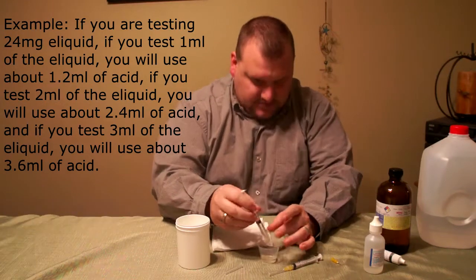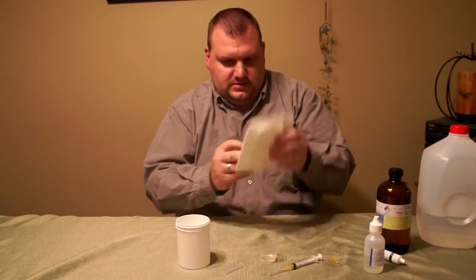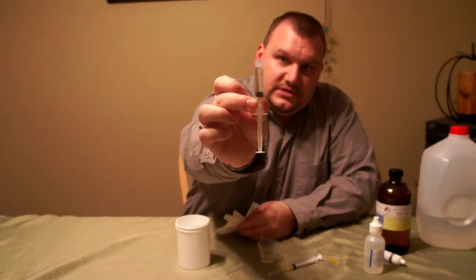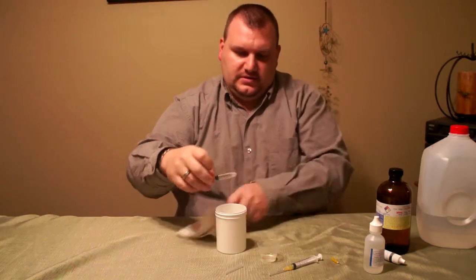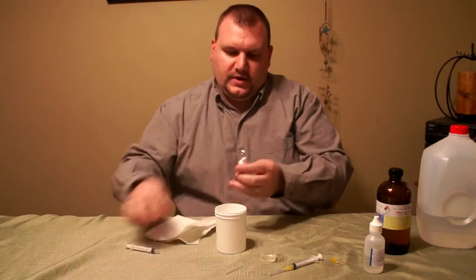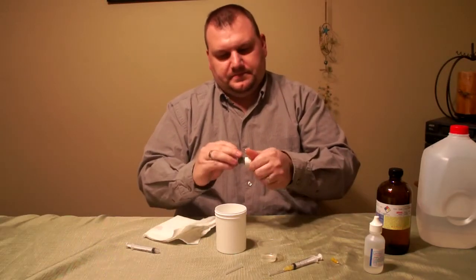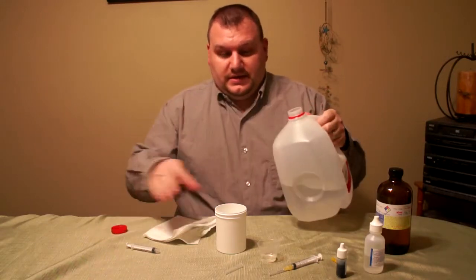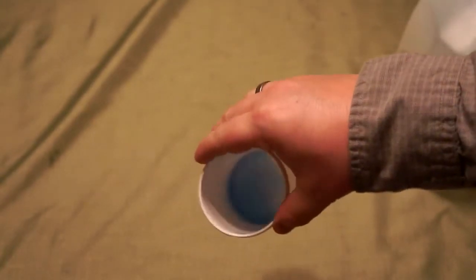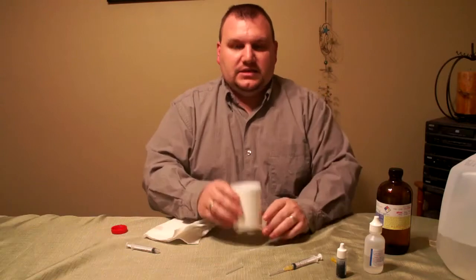I took my syringe, removed the needle, and got the air bubbles out. I now have exactly two milliliters of my supposedly 24 milligram e-liquid. I'm going to put that in the cup, then add six or eight drops of blue indicator. Then you want to add some distilled water — it doesn't need to be exact, just roughly about ten milliliters. You just want the solution thin enough to be easily mixed. Now I have a nice blue solution.